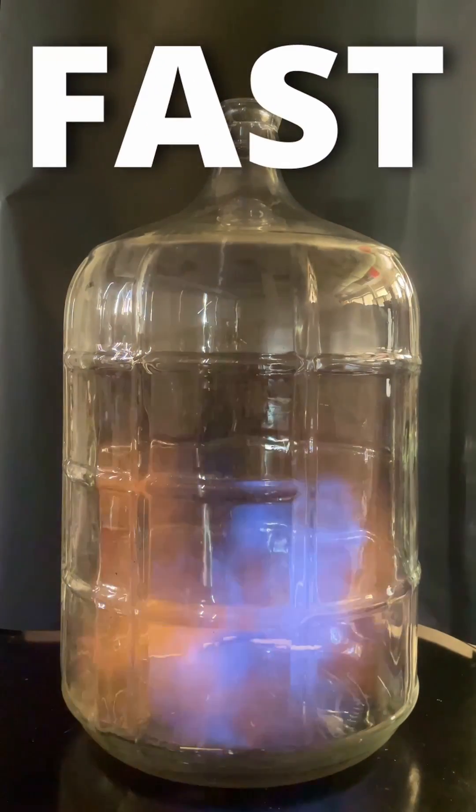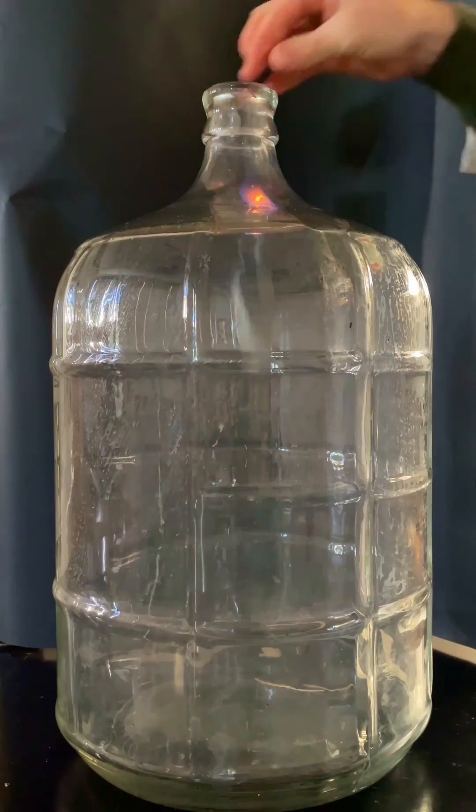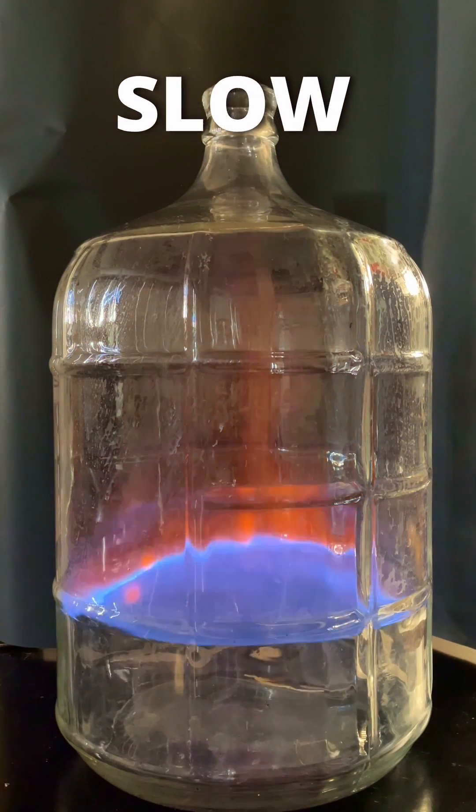The second one is pretty fast. That's when the reaction heated up. The third one is slower. This is because CO2 built up.